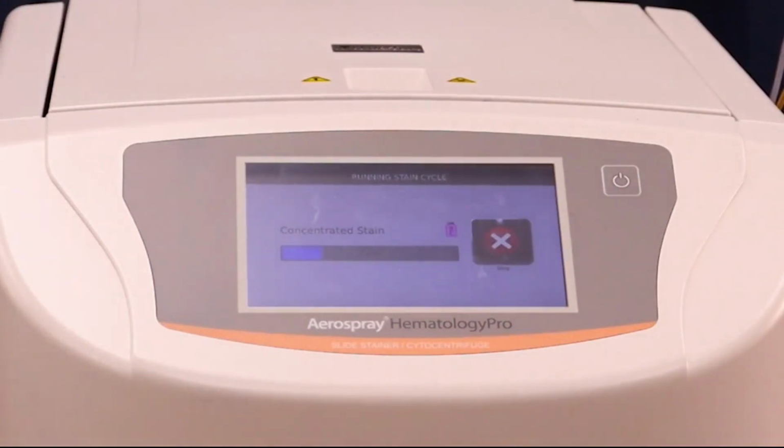After the concentrate stain, the instrument will perform a mid-rinse of the slides. This is done with either a 6.8 or 7.2 pH buffer solution. This step can also be adjusted to increase or decrease the amount of rinsing performed. Then the instrument can apply a diluted version of the stain. This mixes the thiazine and eosin stains with pH-controlled buffer before applying to the slide. The combination of the concentrate and diluted stain give colors that perfectly mimic your standard Wright, Giemsa, and May Grunwald stains. After applying the diluted version of the stain, the instrument will do a final wash with buffer. This step can also be programmed to provide more or less rinsing.